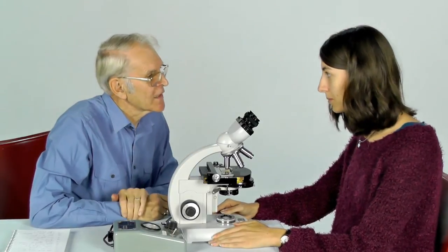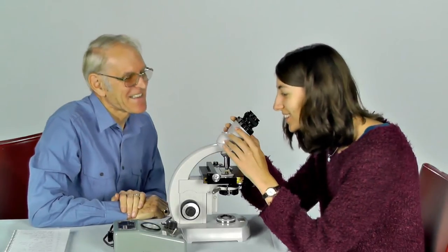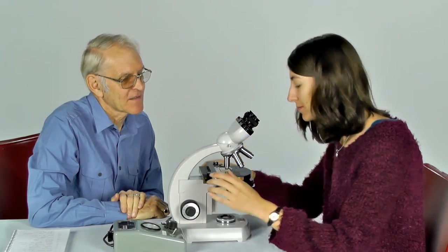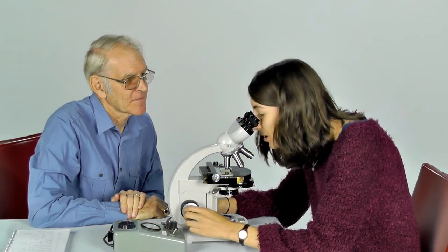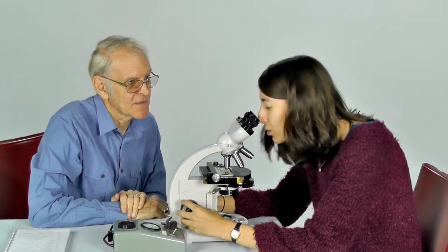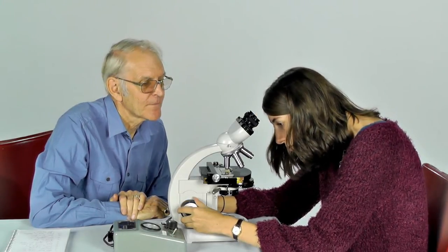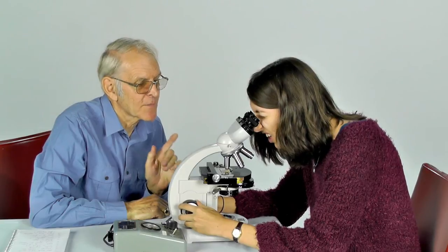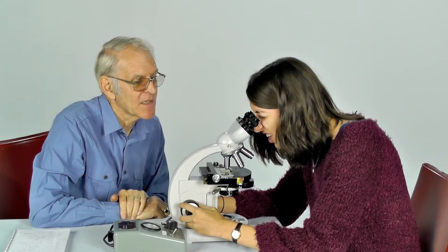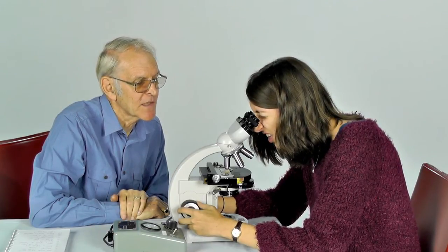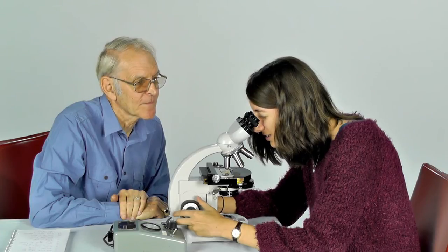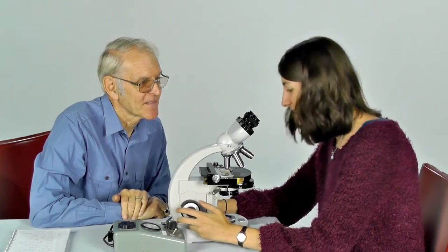Now you're allowed to look down the top. Take the stage back down again, step by step. With the coarse one? Yes, with the coarse one. Is that going down? Yes. Good. That was very sensible. You're checking to make sure that you're moving the stage in the correct direction. Oh, I can see something. Good. Progress.